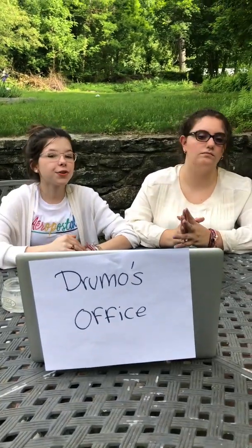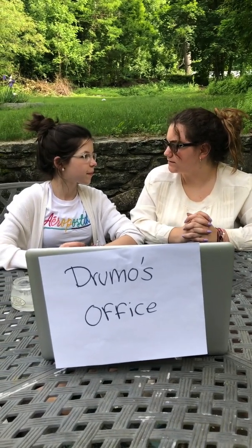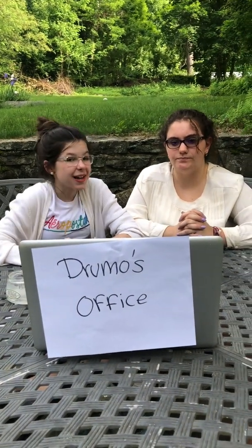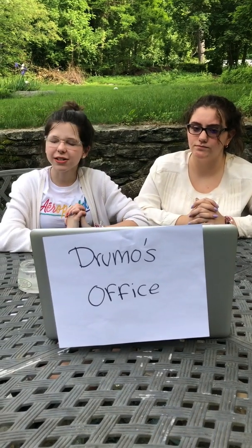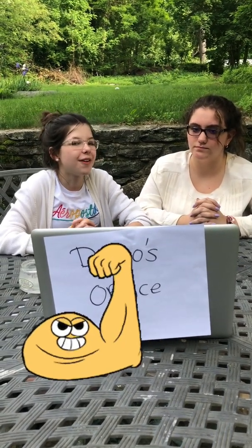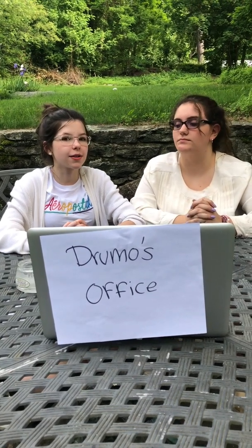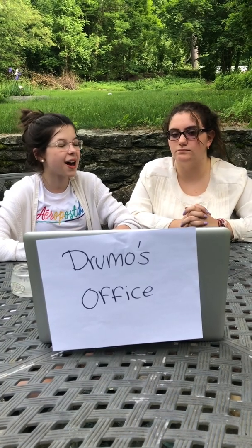So, now that we have cleaned my office, it's our office! That's what I said. Now that we're back and have cleaned our office, it is time to look at a more in-depth and very strong experiment by using potassium iodide instead of yeast and 30% hydrogen peroxide instead of 3%.